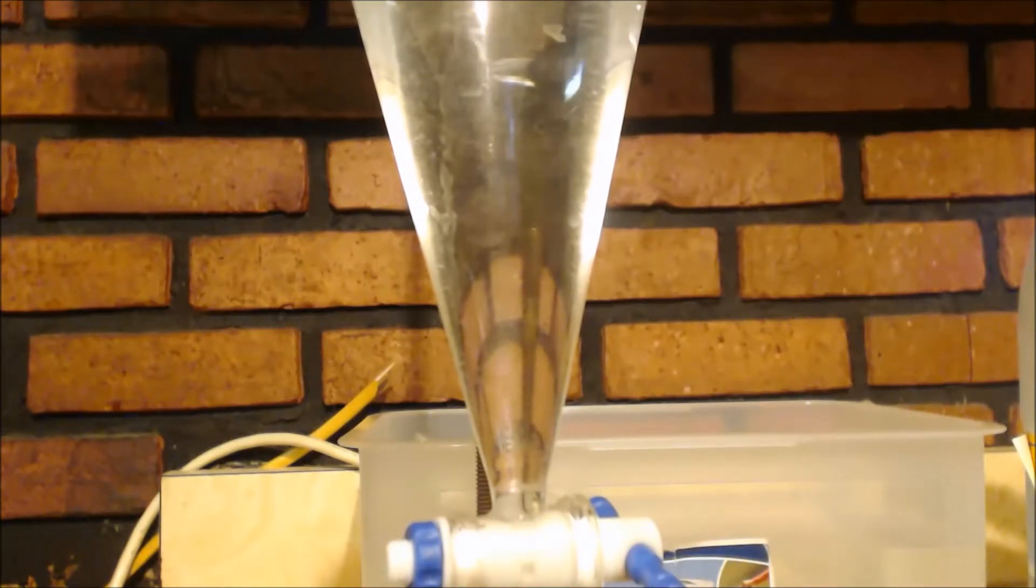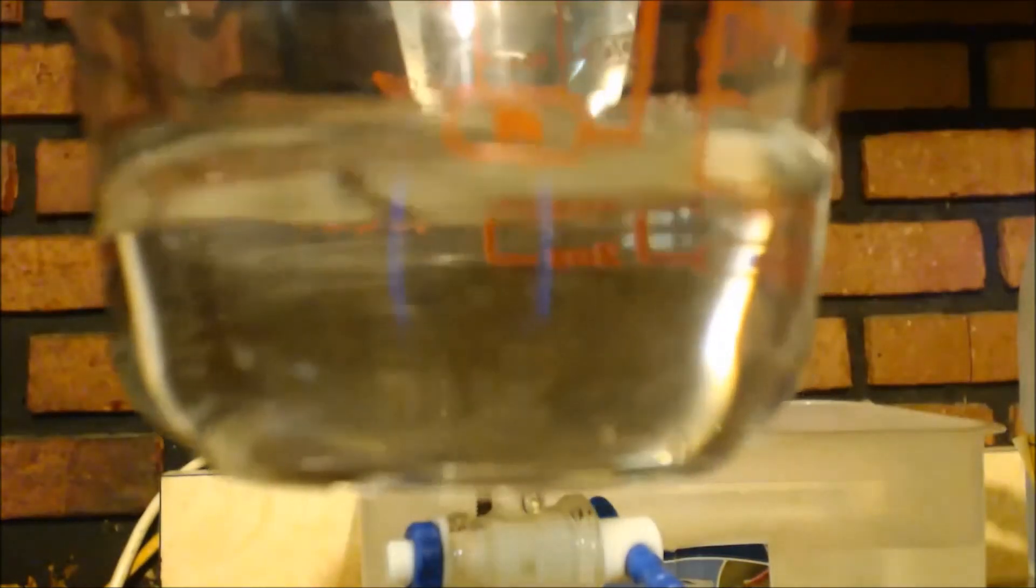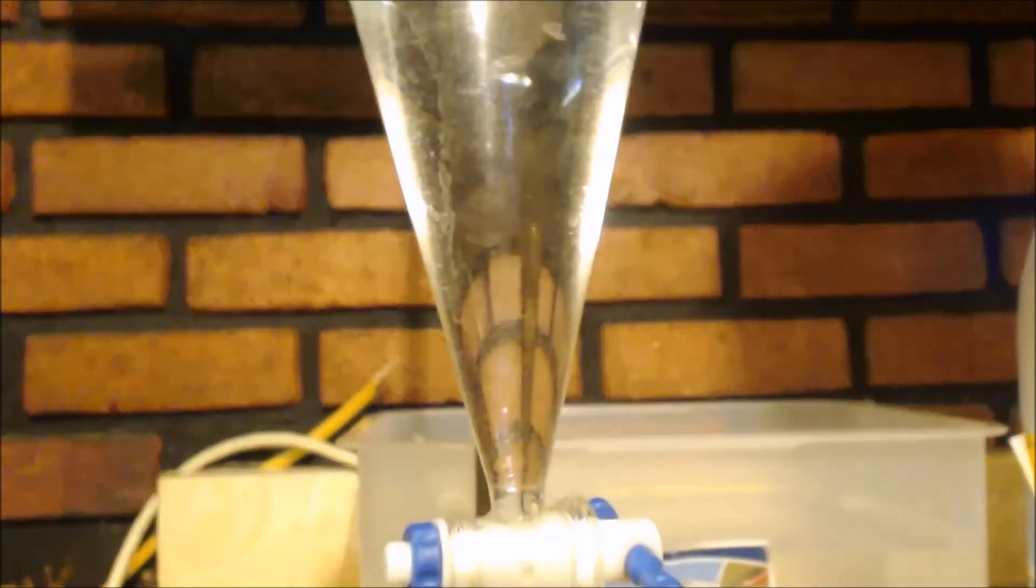There's only, like, a milliliter or two there. Let's see what we got. We got a little over sixty milliliters. It's actually pretty clear. But there's definitely water in there.